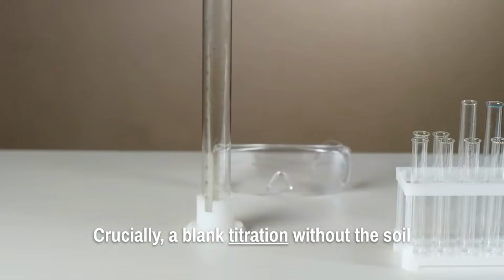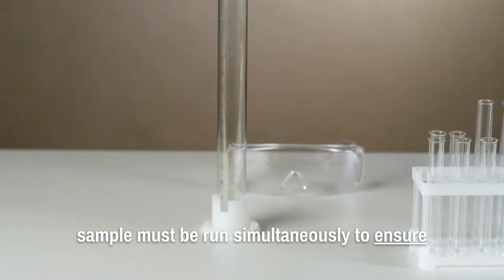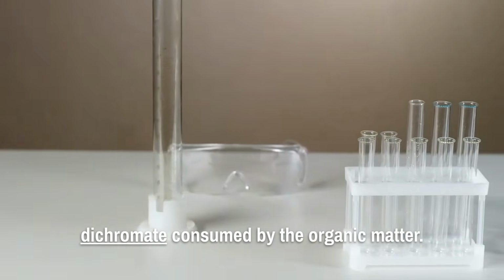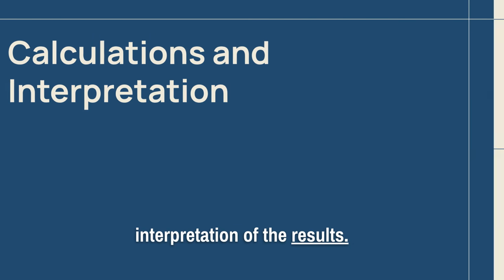Crucially, a blank titration without the soil sample must be run simultaneously to ensure accurate calculation of the amount of dichromate consumed by the organic matter. Finally, we move to the calculations and interpretation of the results.